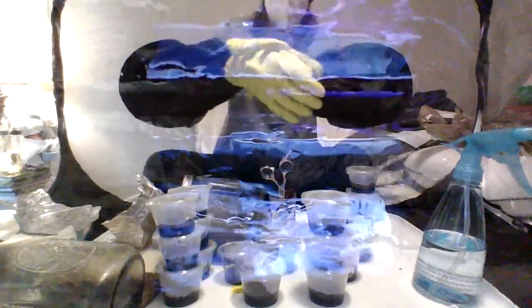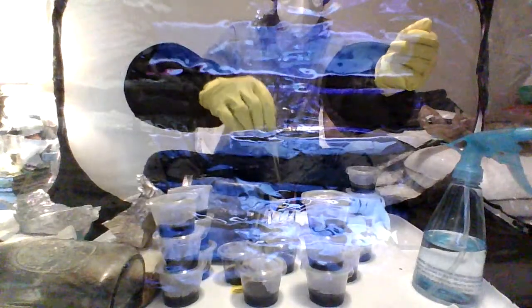All right, there's a light mist in here now, 70% isopropyl. See here, I have my all-metal stainless steel scissors soaking in rubbing alcohol. I'm now going to wipe them off. I don't want them to stay completely drenched in rubbing alcohol. It has effectively sanitized the surface as well as it's going to. And like I said, this cloth is also damp with rubbing alcohol, and it's clean.